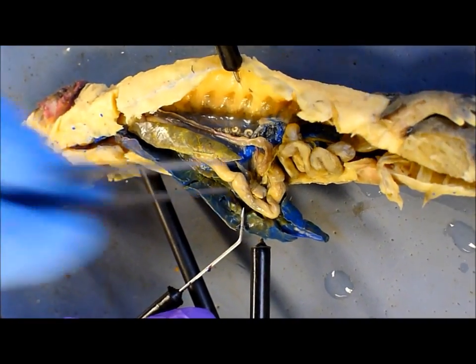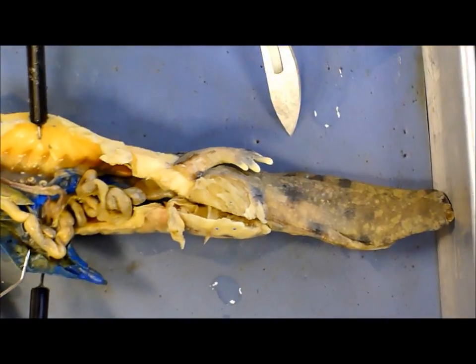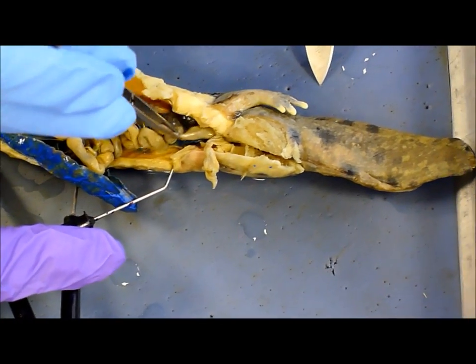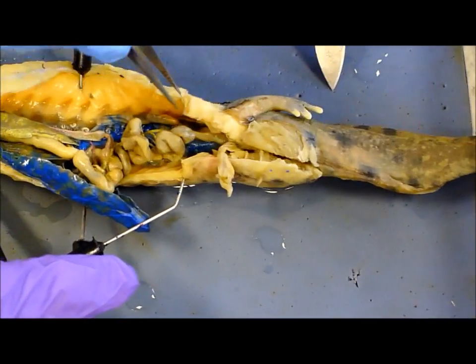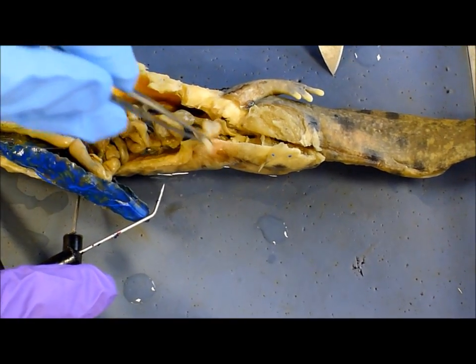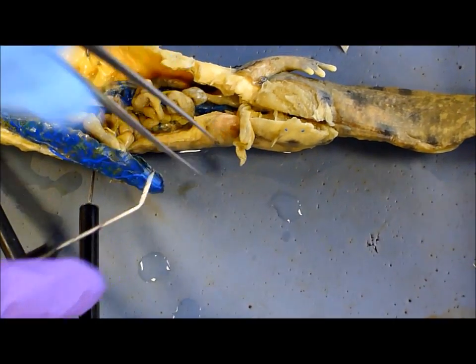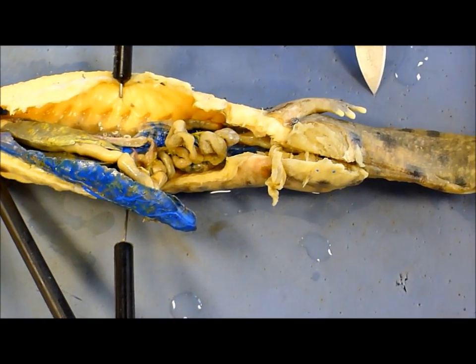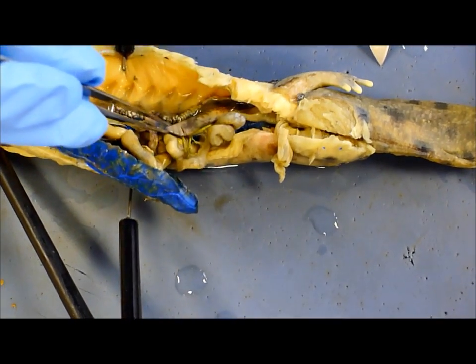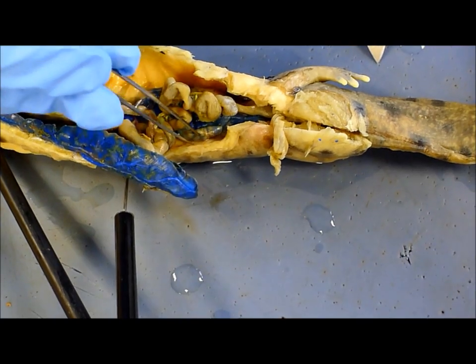Cloaca. Large intestine right here. Urinary bladder — this balloon thing right here. Testes: this one and then that one.